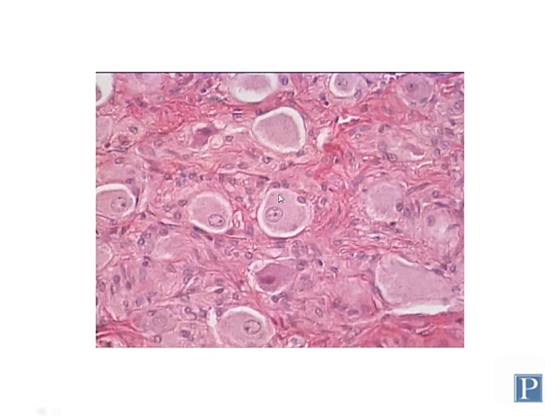So these are multipolar sympathetic motor neurons here. They also have large cell bodies, a prominent nucleus and nucleolus. Note that the nuclei of these cells tend to occupy a more eccentric position within the cell, meaning that they are closer to the edges rather than in the middle.